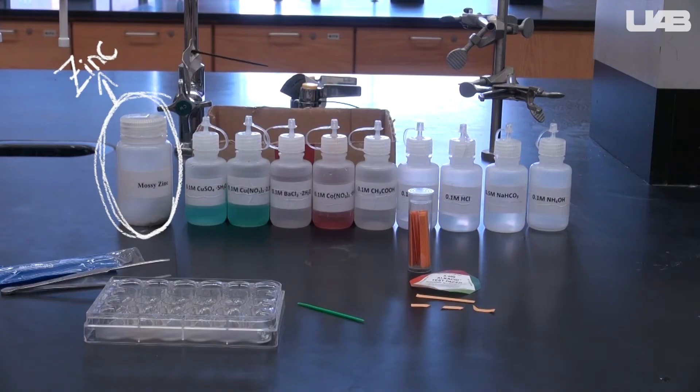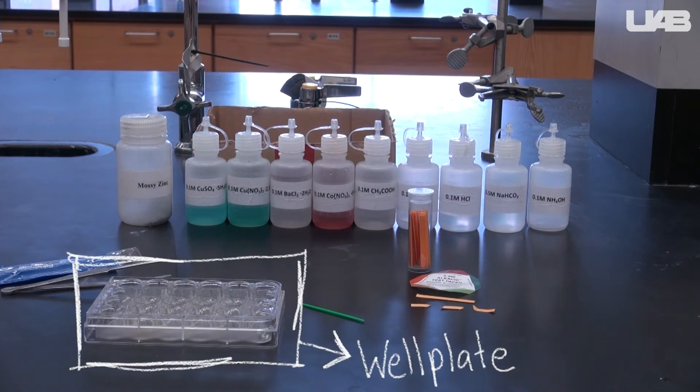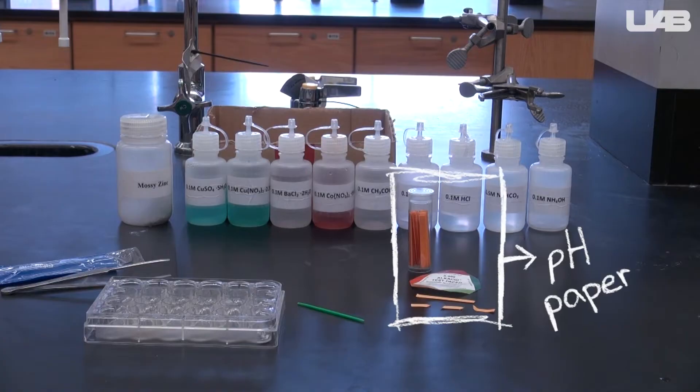You will need some zinc, a set of the solutions, a pair of tweezers, a well plate, a toothpick, and some pH paper.